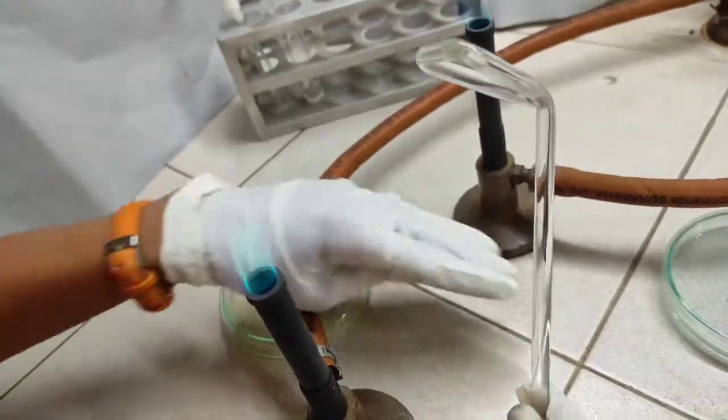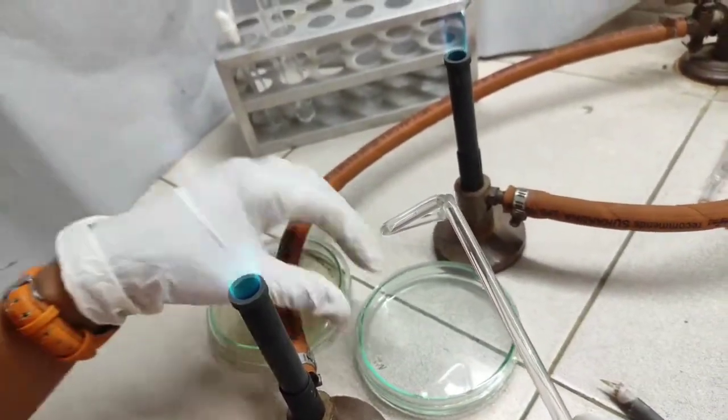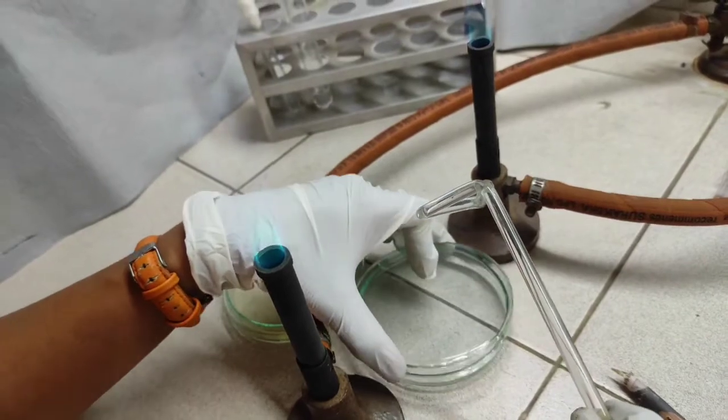This is a spreader used for spreading that suspension of organism.